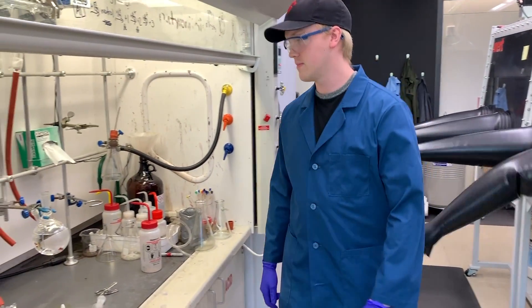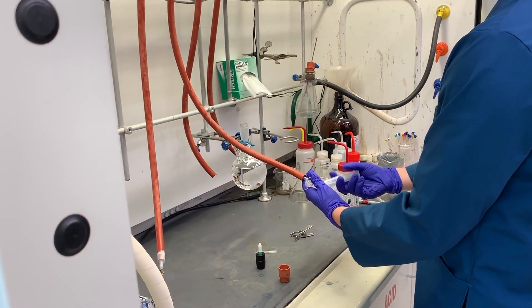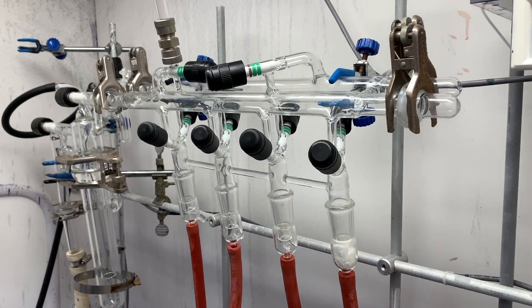We started our Schlenk manifold but will only need to use the nitrogen inlet. Take an air-free flask, preferably a Strauss flask, and fill it with your liquid.